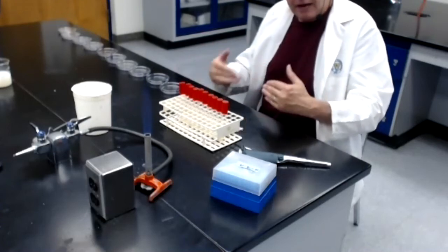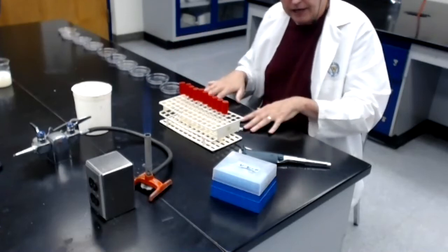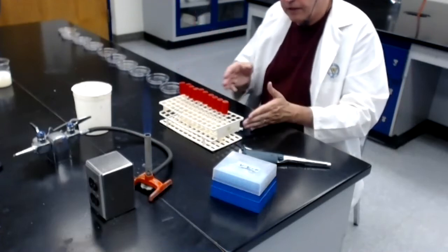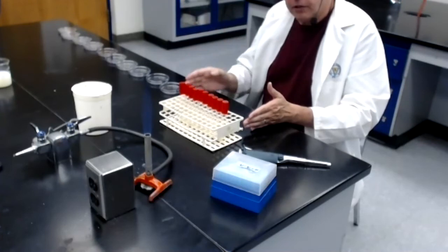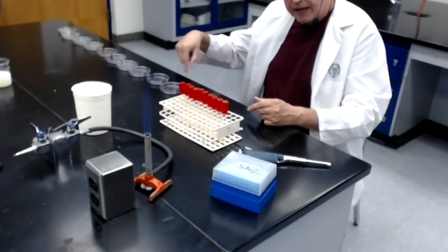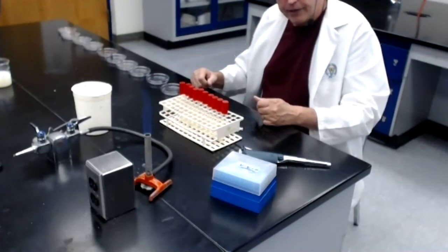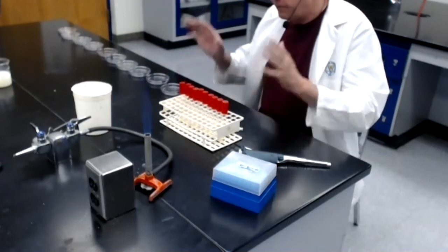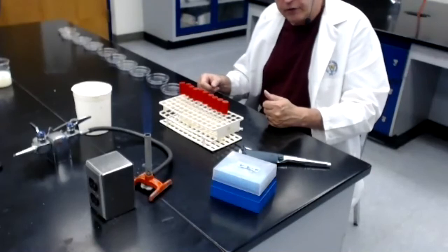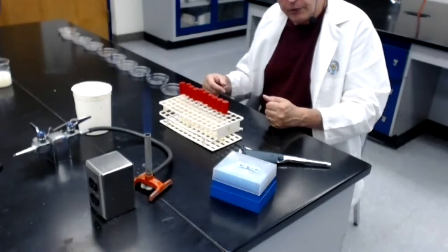Okay, now I'm going to have to move quickly here because the agar will cool off quickly and then it will harden on us. And I have to make sure that I have enough time to add 1 mil of the dilution to 10 mils of agar, mix, and then pour the melted agar bacteria mixture into the first plate here and move it around to cover the bottom of the plate. I have to be able to do all that before the agar hardens. As soon as I take the melted agar out of the 55-degree water bath, it begins to cool, and I probably have less than a minute to complete that step.